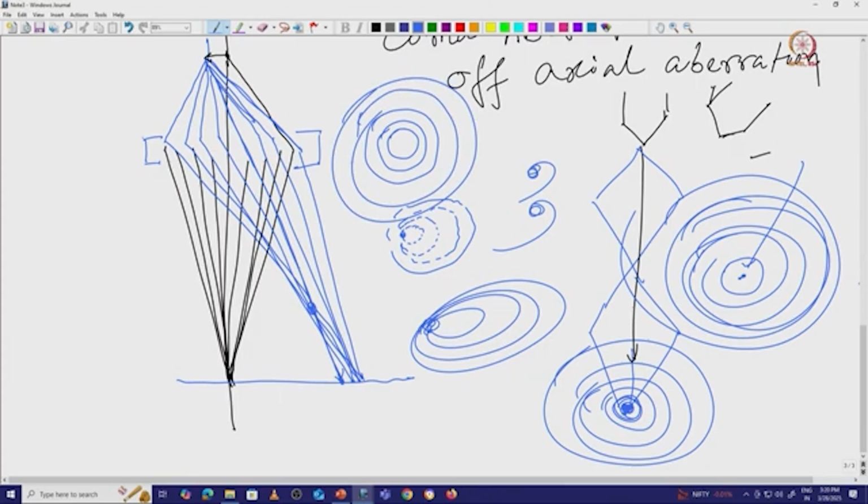So if we have a coma aberration, what will happen? You cannot see those rings anymore in your power spectrum. You will see only a center bright spot. That means there is some kind of alignment issue, and our signal is so poor, it is being affected because of the coma.